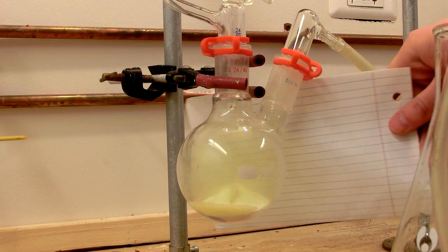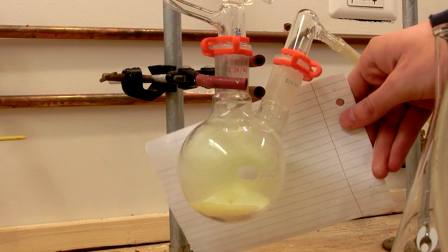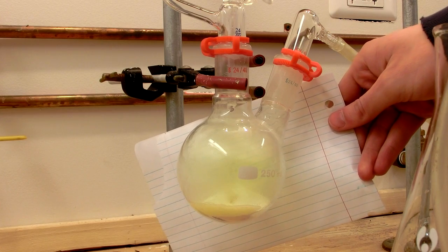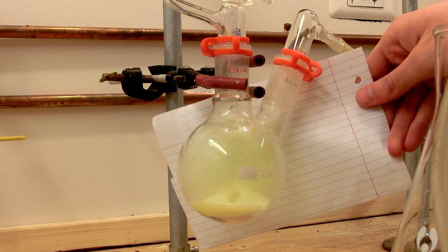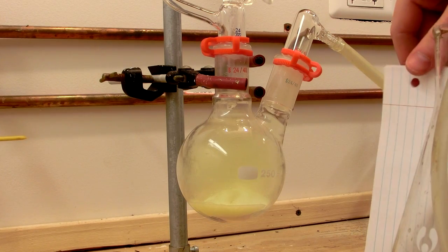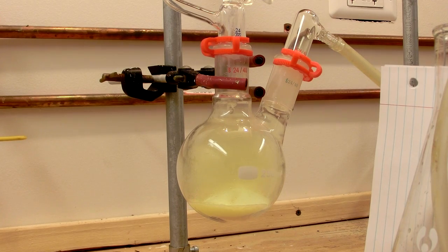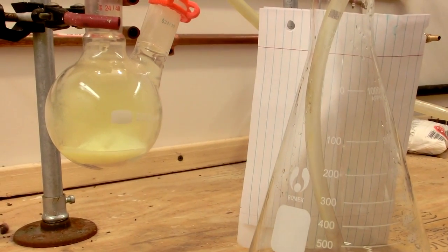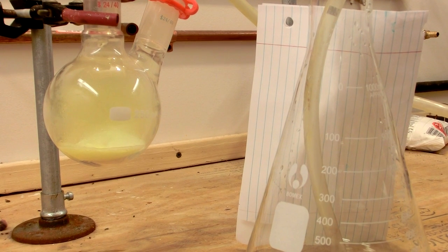Using a white piece of paper you can tell that the flask, the gas in the flask is definitely green. I'll use the white piece of paper against the flask there so we can tell when it's filled with chlorine gas.